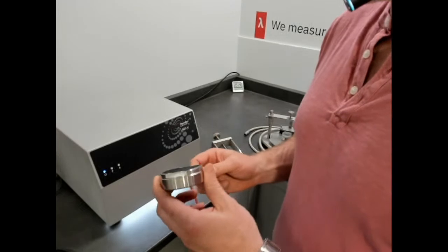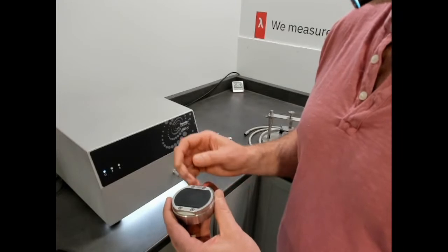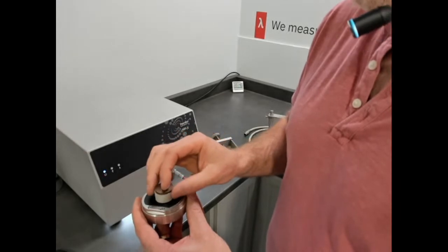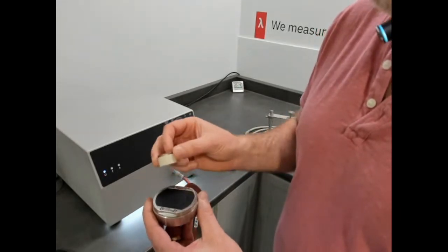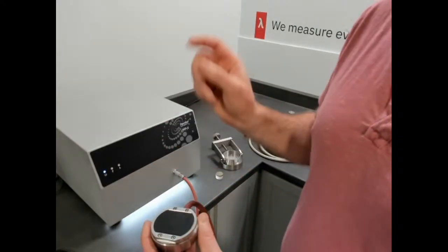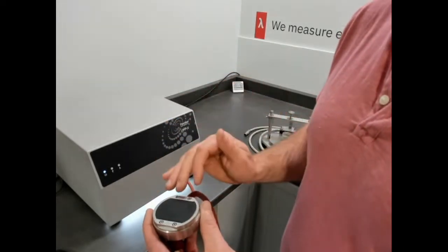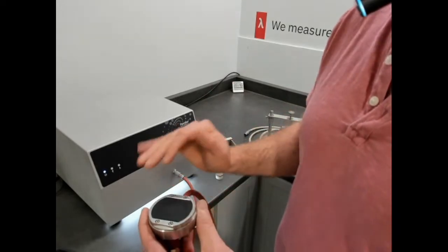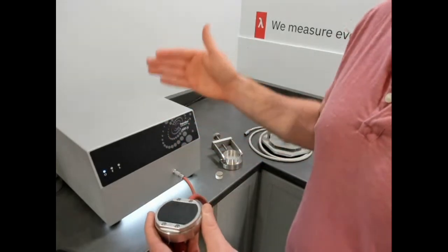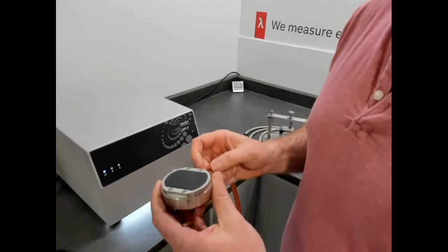Additionally, you can use this same single-sided asymmetric or modified transient plane source sensor for measuring bulk properties, which is what we're going to set up. This is Pyroceram. This is a certified material for thermal diffusivity, Pyroceram 9606, but you can also measure one-dimensional. So the module for measuring along the height of a sample. You can also measure asymmetric slab, so that's for a conductive sheet. And you can measure anisotropic. So you can measure all of the different modules with this exact sensor. We're the only ones that do some of those single-sided configurations.